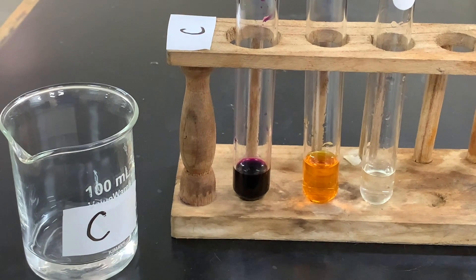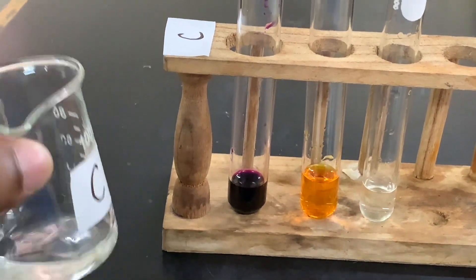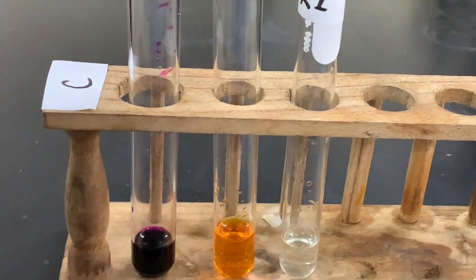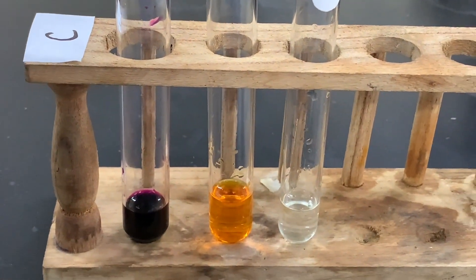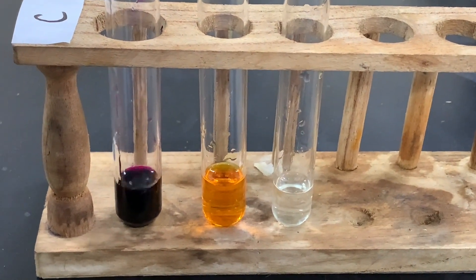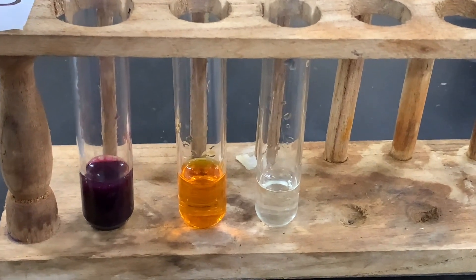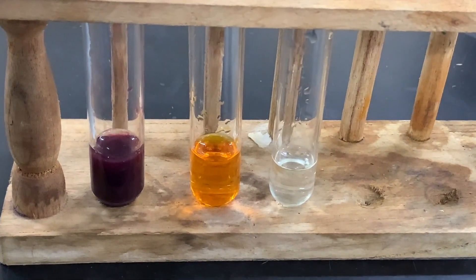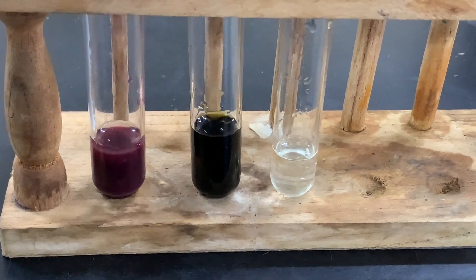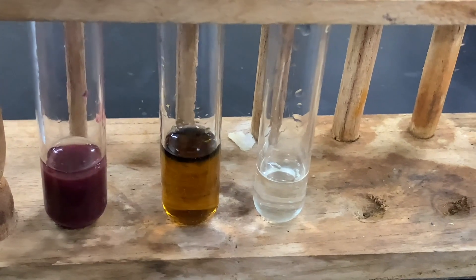We're down to the third and final substance, substance C. Again, colorless liquid. We're going to be adding a small amount to acidified potassium manganate 7, a small amount to acidified potassium dichromate, and a small amount to acidified potassium iodide.